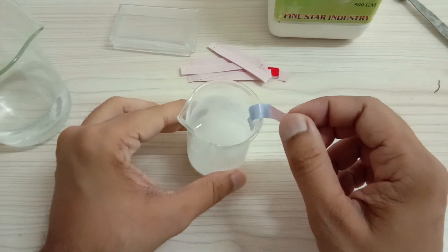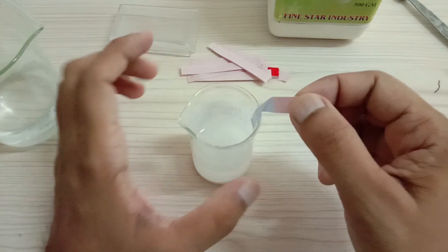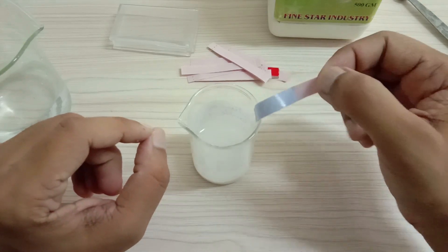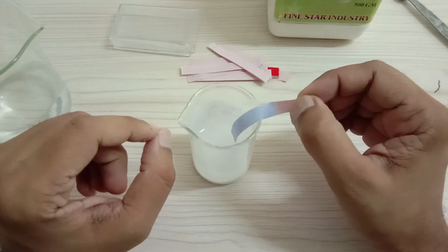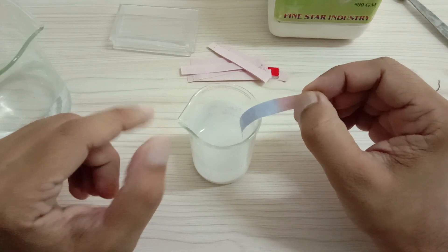Now why is it so? Because calcium hydroxide is formed as a result of calcium oxide dissolving in water, but not completely.